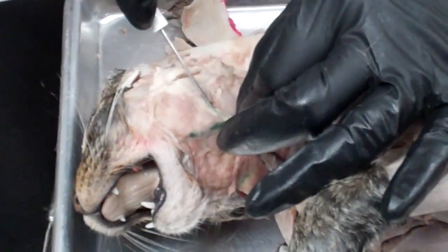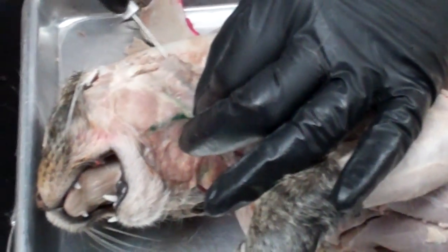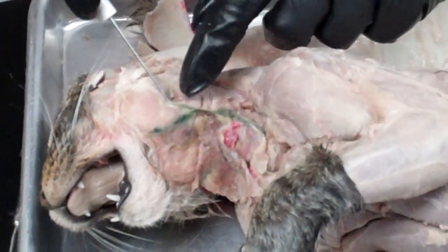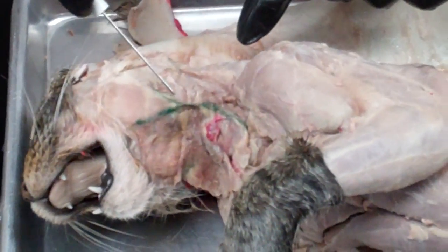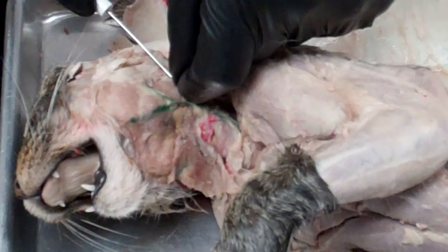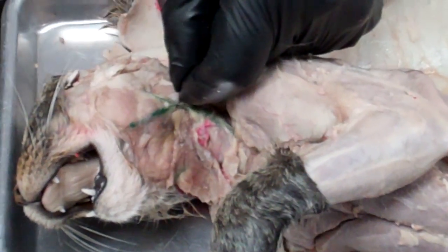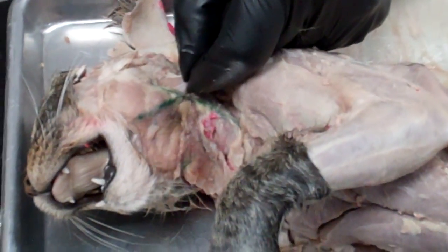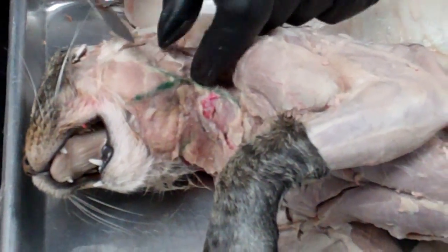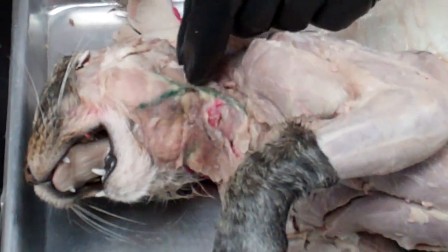Without destroying the blood vessel, since that's part of our blood vessel dissection, you want to remove the fascia and connective tissue covering around the submandibular gland.